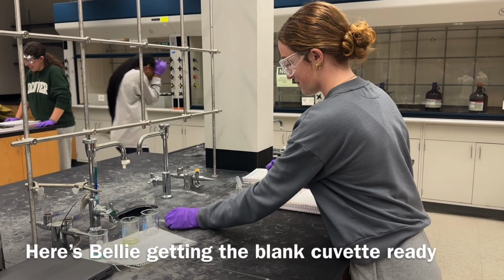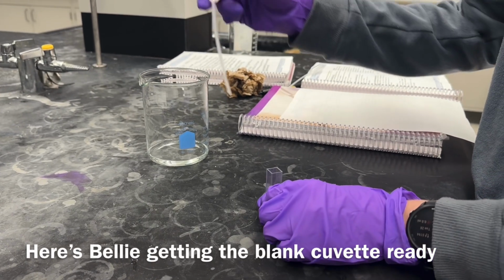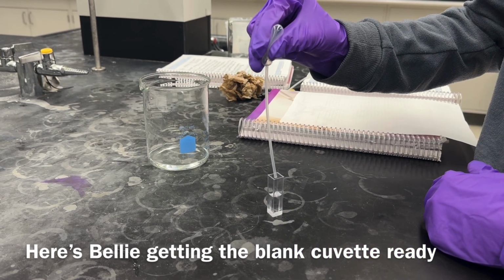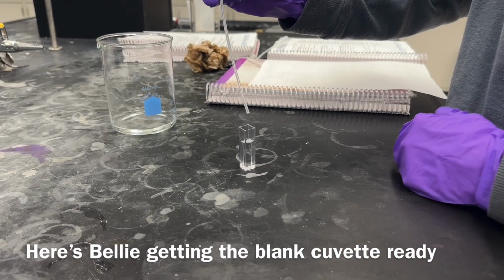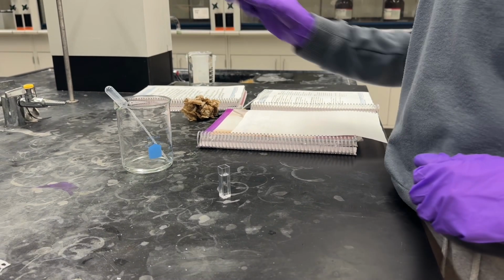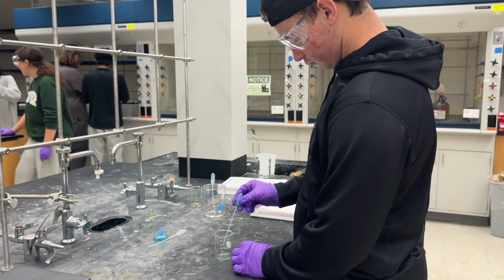One is going to be the blank, which has the deionized water, and then the other 3 colors that you get from the lab. Now, you may be asking why there's a little blank cuvette. Trust me, you'll find out soon. Just keep that in mind. Anyway, for the remaining 3, take a small portion using a pipette and fill the rest up to the mark with the deionized water.